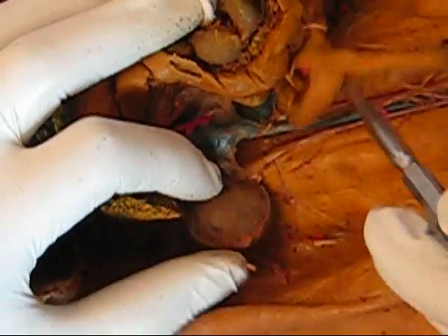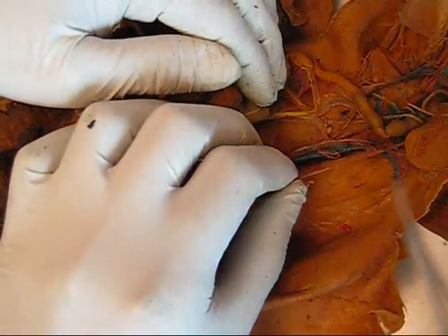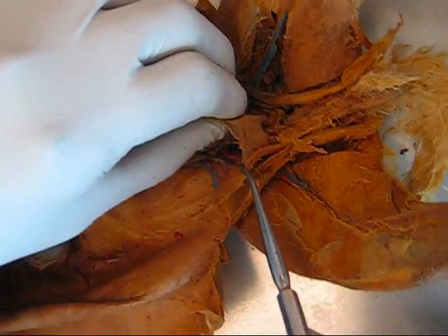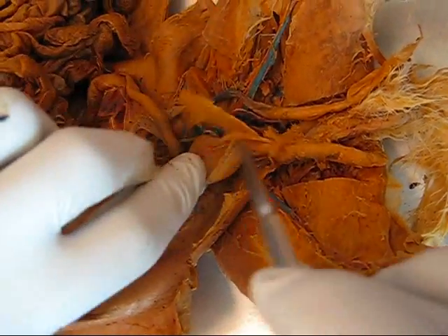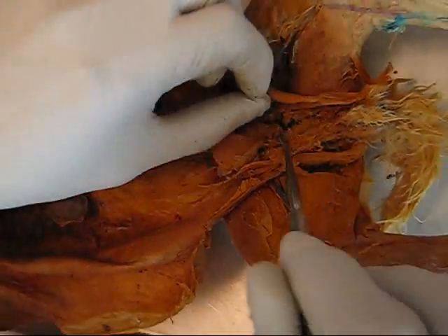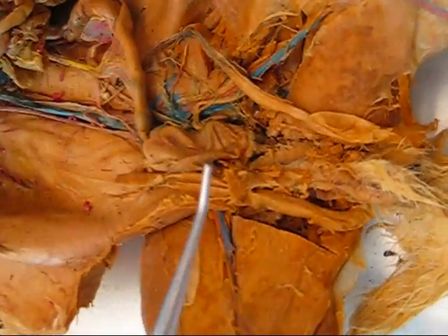Ureters — here. Urinary bladder — this sac here. Suspensory ligament. Lateral ligament on either side of the urinary bladder — but here they've been ripped. Urethra — here is the urethra. Adrenal glands — here.